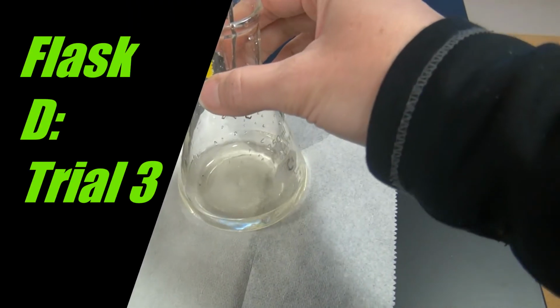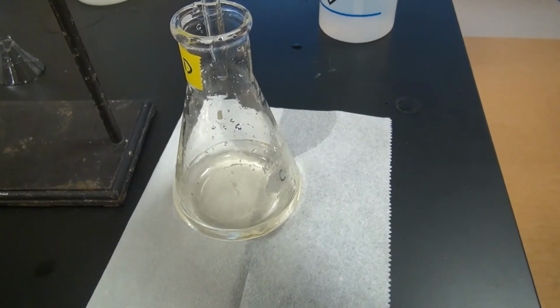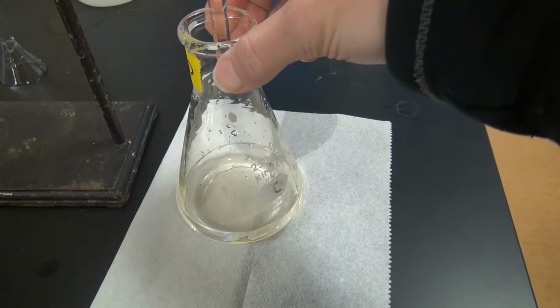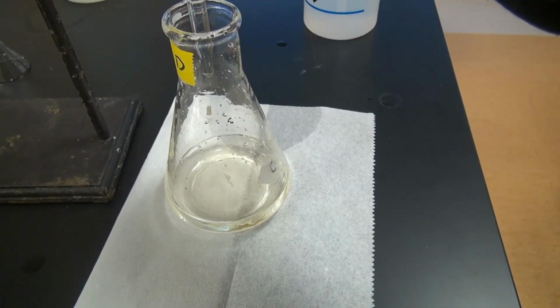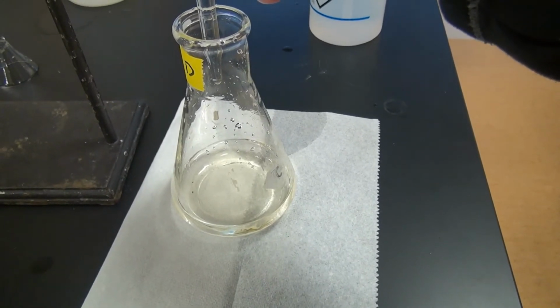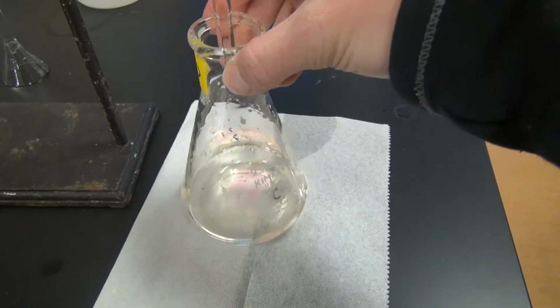Okay, this is our last trial, flask D, on the vinegar, or excuse me, the tartaric acid in white wine determination. And we're starting at 0.00 again on the burette. Put a nice steady slow drip here.